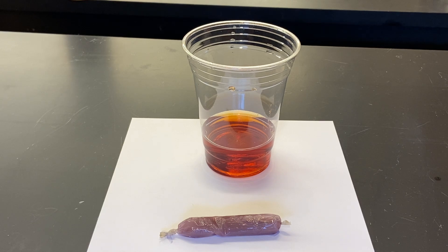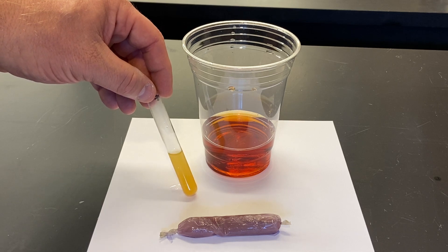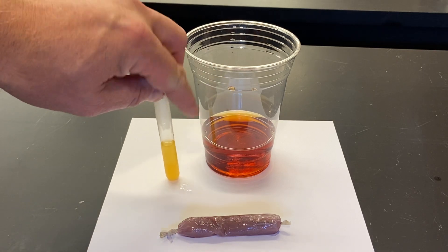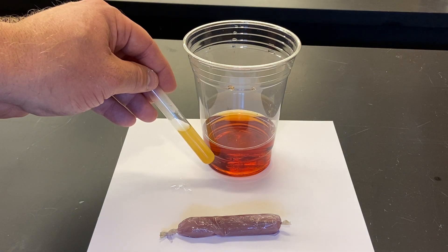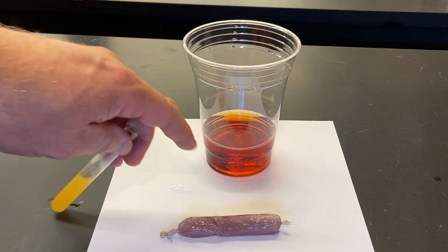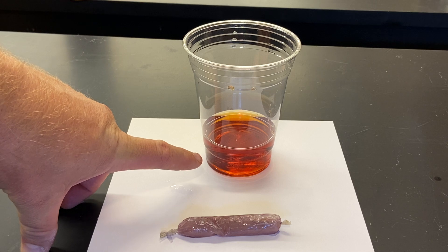What I've done is take a few drops of the solution and put it into a hot water bath with a few drops of Benedict's — a blue-colored testing solution. This orange, or sometimes brick-red, coloration indicates there is indeed glucose present. So that implies glucose came out of the cell. The lugol solution went into the cell, but you'll notice nothing happened with the starch — the water in the cup stayed the amber color of the testing solution, confirming no starch came out.